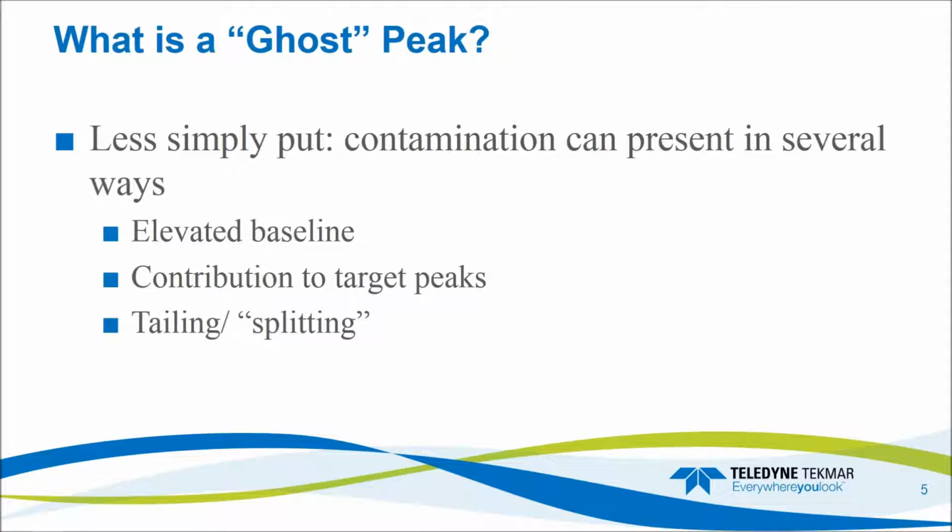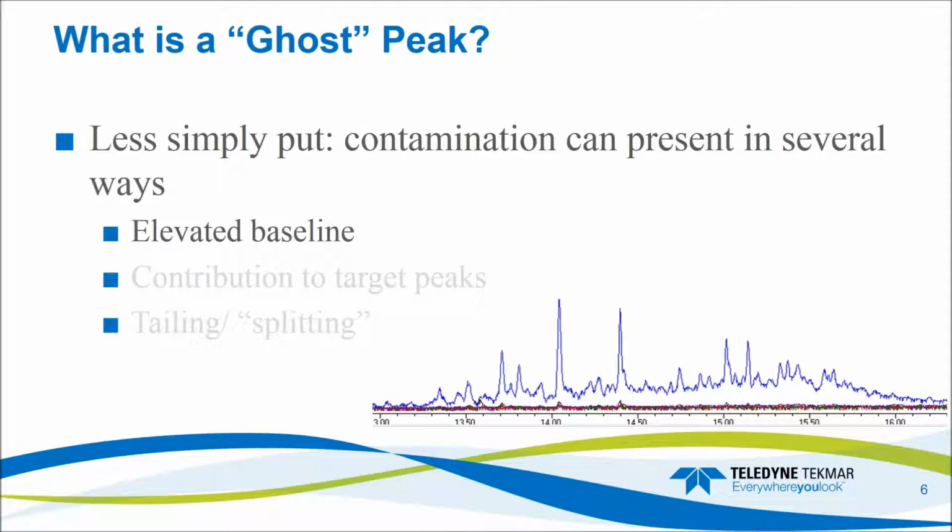Okay. But not all contamination is that straightforward and that easily identifiable. There are several other types of contamination that we have to deal with, and that could be an elevated baseline or a foreign compound contributing to target peaks, and last but not least, tailing or splitting of our target compounds. So for instance, here's an example of several runs in a row where we had a nice clean system, we have a nice calm, quiet baseline, and then we had something happen to our system, and now our baseline is significantly elevated. There's also a lot of contamination in here. Now, maybe an elevated baseline doesn't cause issues, maybe it does. In this case, let's say, for instance, this peak right here is a target compound. Well, because our baseline is now elevated, the peak area we see is less than half of what could be there if we still had our nice, clean, low baseline. So it may affect our low-end sensitivity.